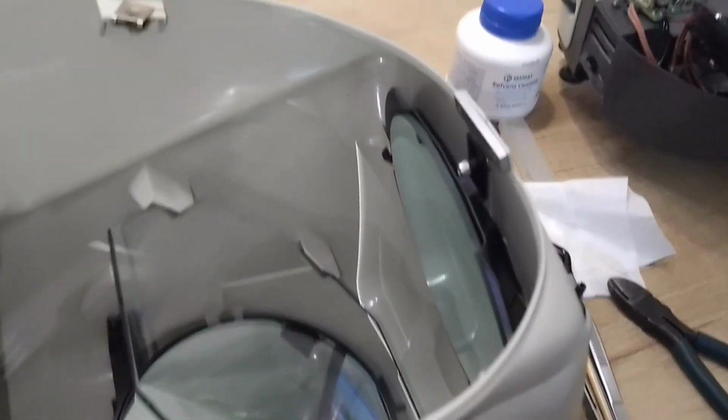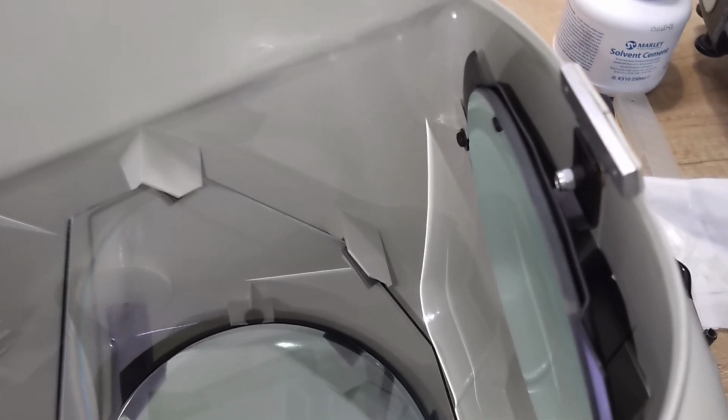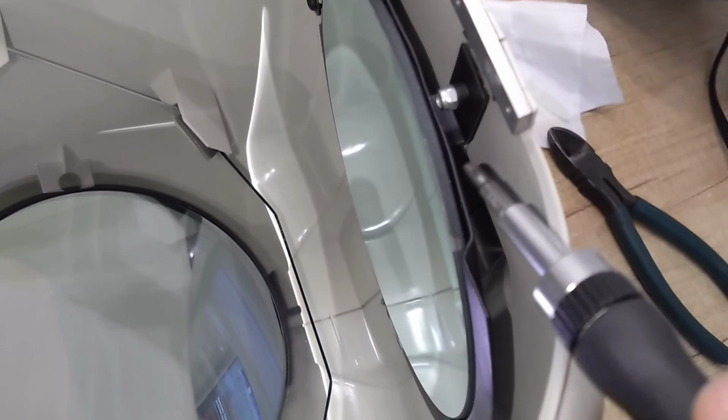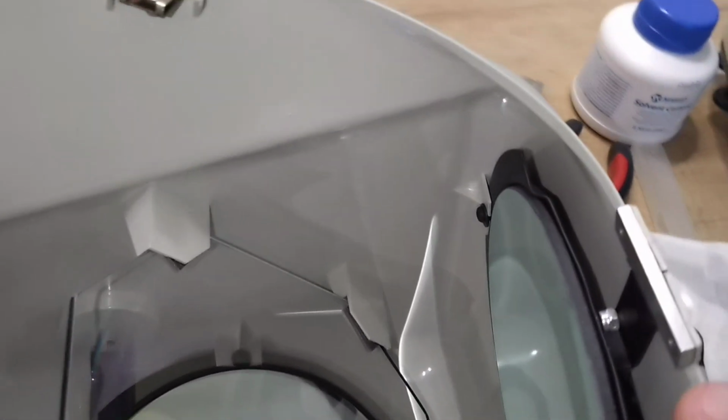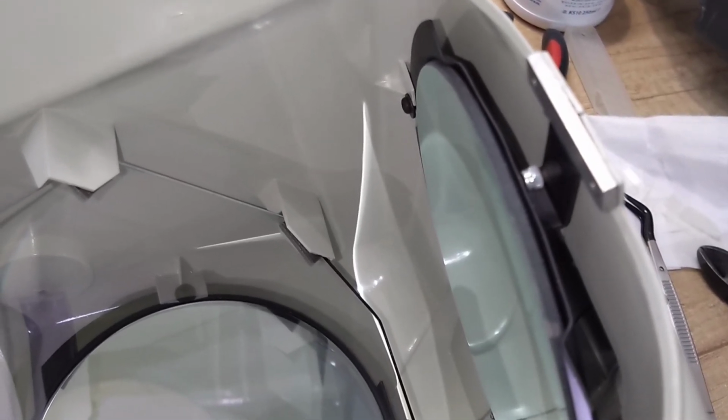And now I want to say a few more words about, well, if it can be called that, adjusting the microscope. Probably every owner should do this for themselves. Here is a screw on the outside. In the middle there is a mirror mount, and this part is spring-loaded, and when you turn it like this, the plate bends, pressing either closer to the body or moving away from it. And in this way, I think you can reduce some of the doubling if you are experiencing it.